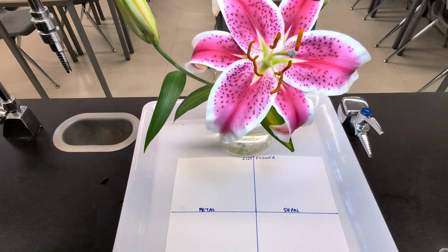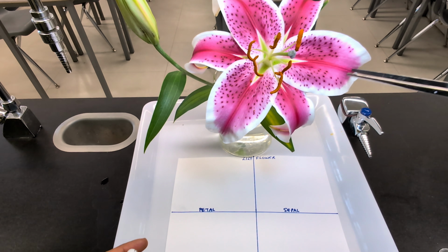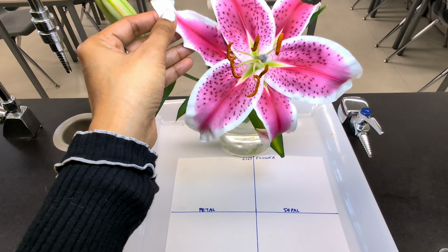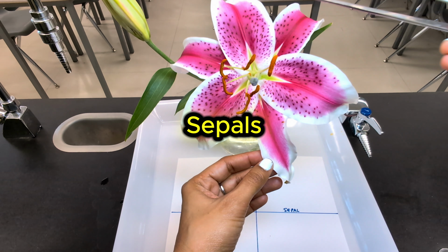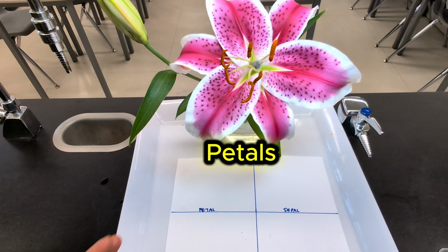Now in lilies, the sepals and petals look very similar. So they're actually called tepals. Now, if we take a look, we have 1, 2, 3. So these big ones are the petals. And if we look again, we have 1, 2, 3 smaller ones. Now, the smaller ones are known as your sepals, and the bigger ones are your petals.